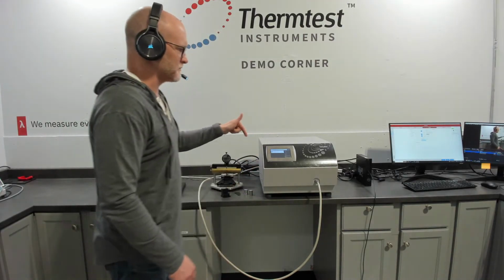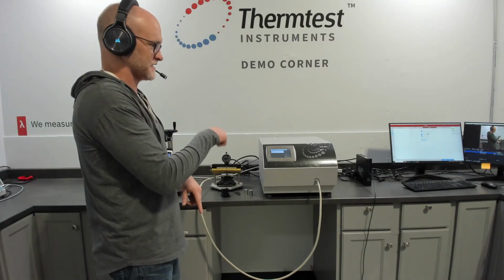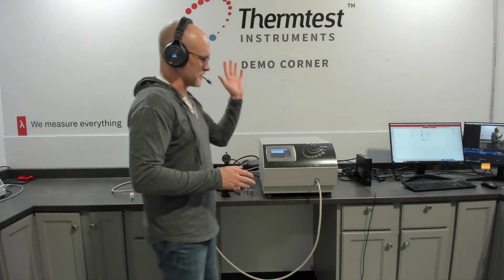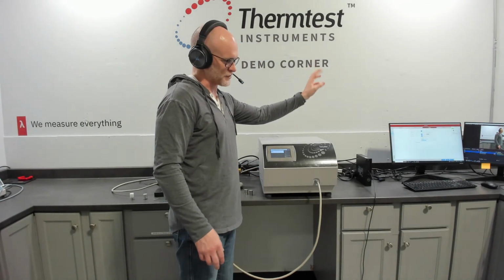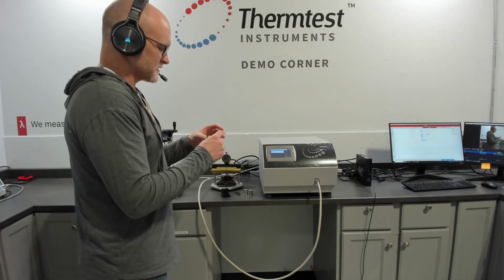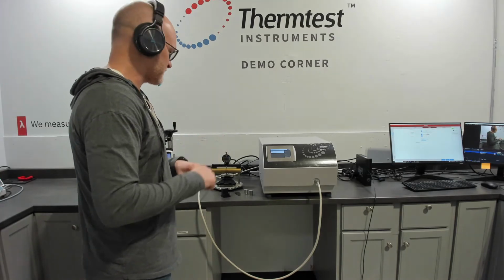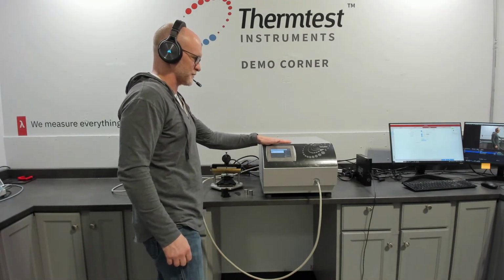So some of the other methods that you can add to this, in addition to the transient plane source, following the ISO 22007, are transient hot wire for measuring thermal conductivity, diffusivity, and specific heat of liquids following the standard, as well as transient line source following ASTM D5334-22A, and transient hot strip, which is a unique sort of square sensor that allows you to measure some unique capabilities of more rectangle type samples. It allows you to get down to 3 dimensions. So depending on your configuration of samples, that's the transient hot strip. So there's actually 4 sensors / methods that are available for the MP1.